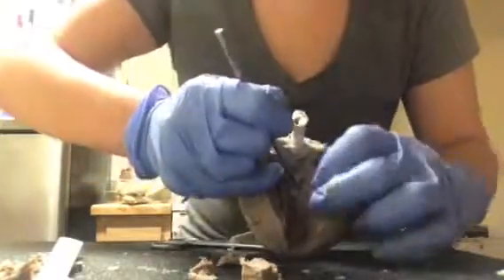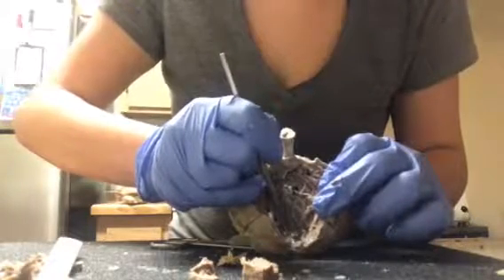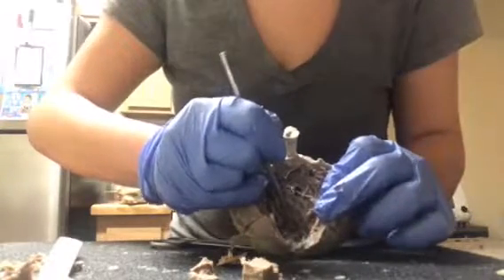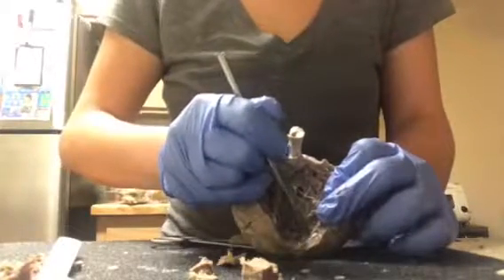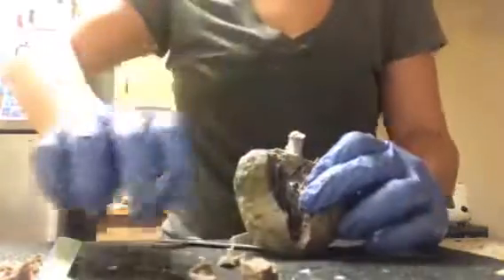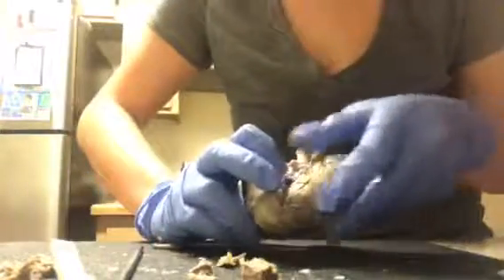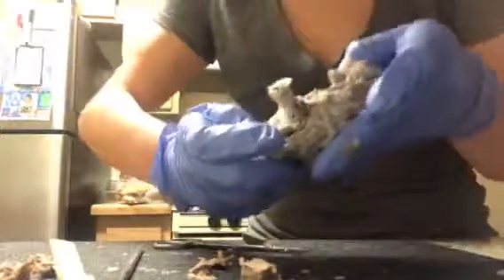And then if you go down a little bit and then to the left, that will be the chordae tendineae, and that's right there. So now I'm just going to get some pictures and I will upload it to my lab. Very interesting.